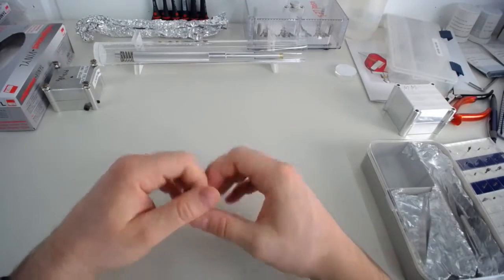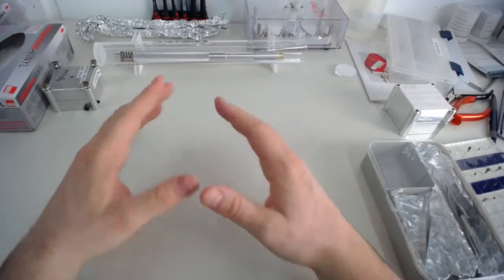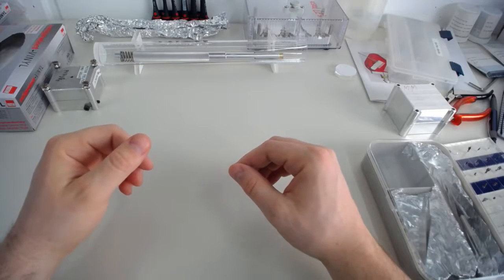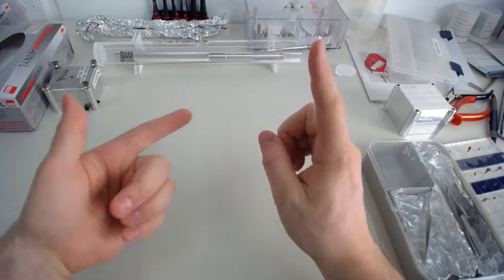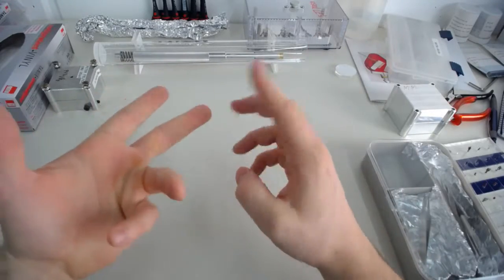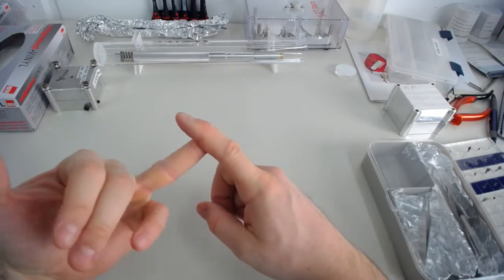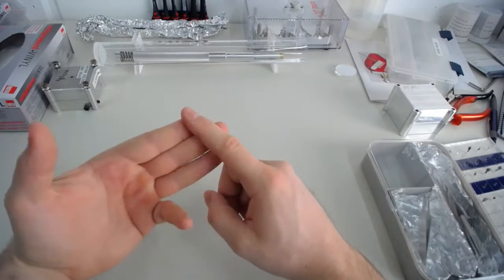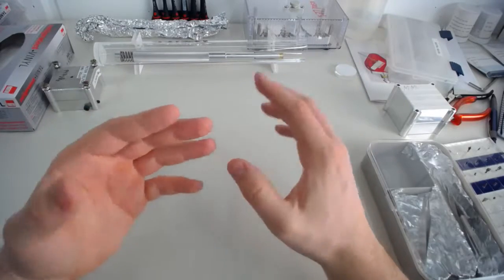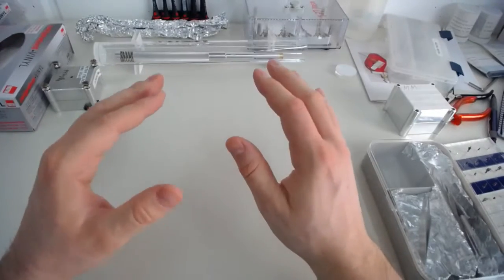Okay, the first step is we need to prepare our work area and prepare our hands. In order to prepare the work area, I'll lay down some aluminum foil. The aluminum foil, if it comes fresh off the roll, it's free of grease, it's free of moisture if it's been stored in a reasonably dry environment, and most importantly it's free of dust. And this is why every single time you insert specimens or take them out, you need to lay down a fresh layer of aluminum foil. This is very, very important.